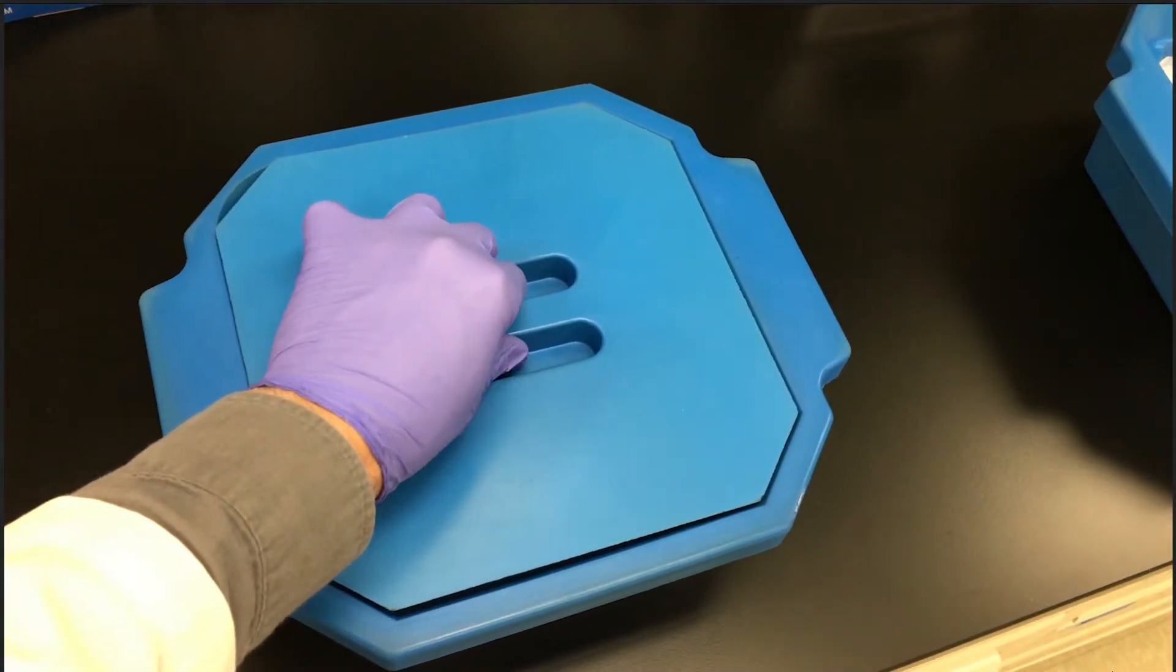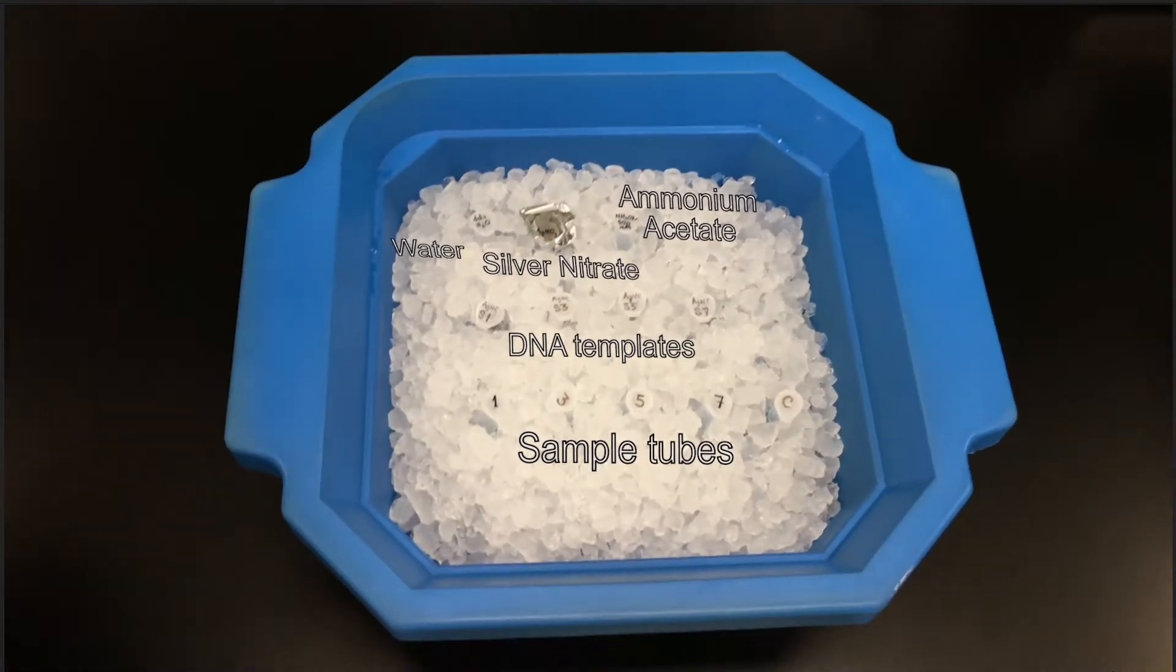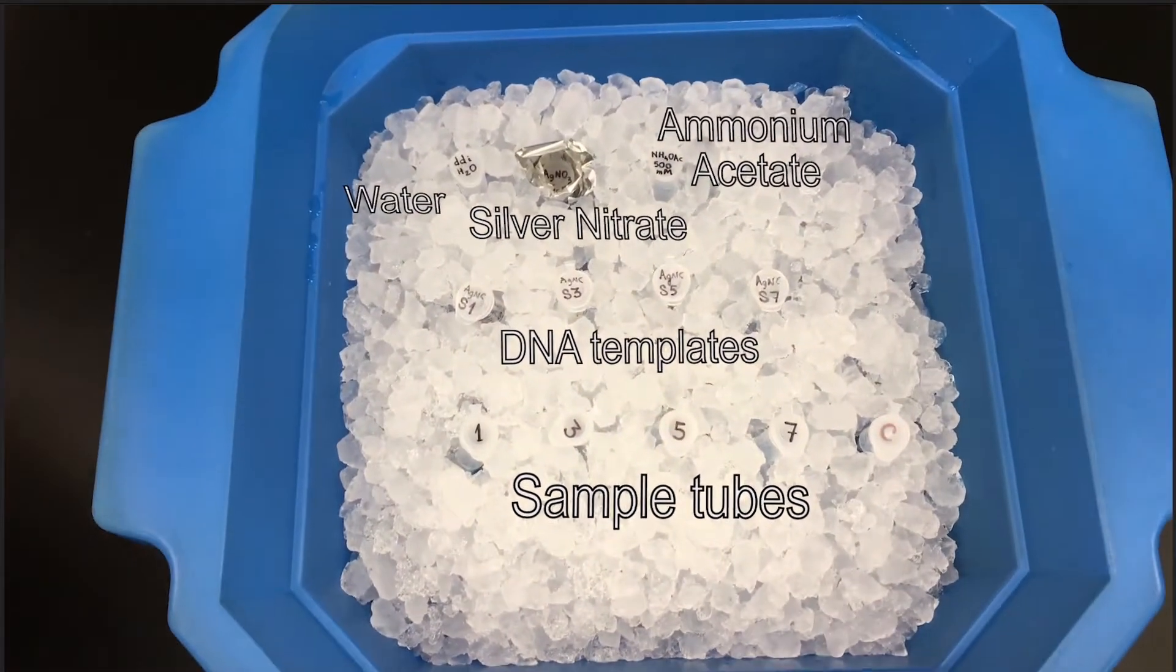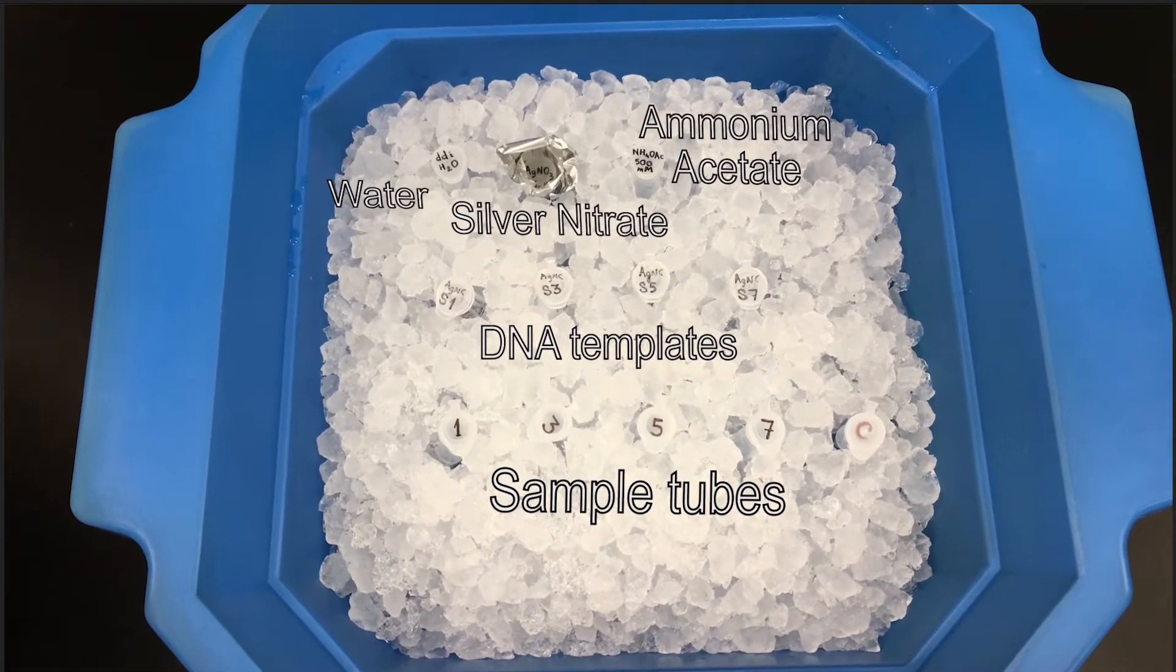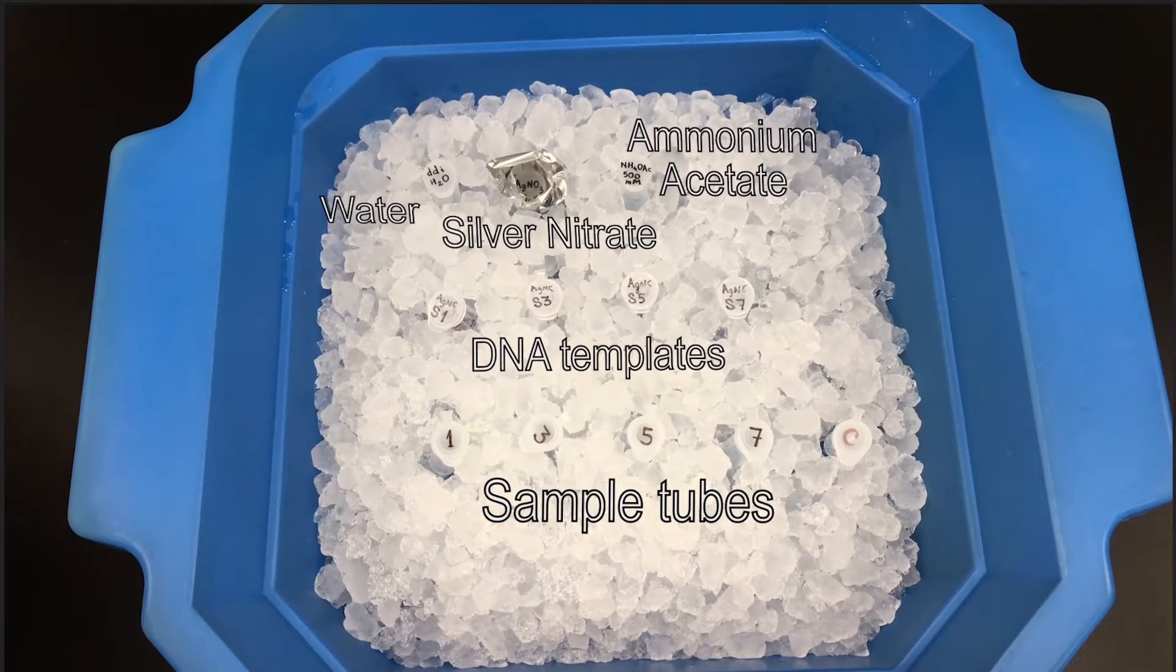The reagents we will need include water, silver nitrate solution, ammonium acetate buffer, and DNA templates. Later we will also use sodium borohydride.